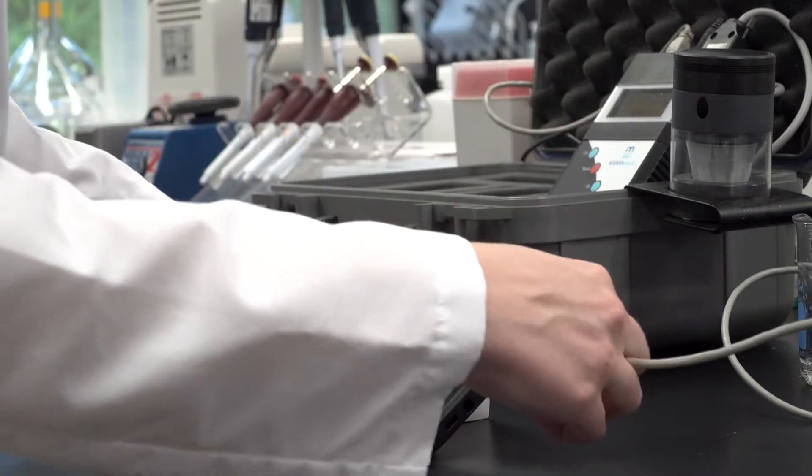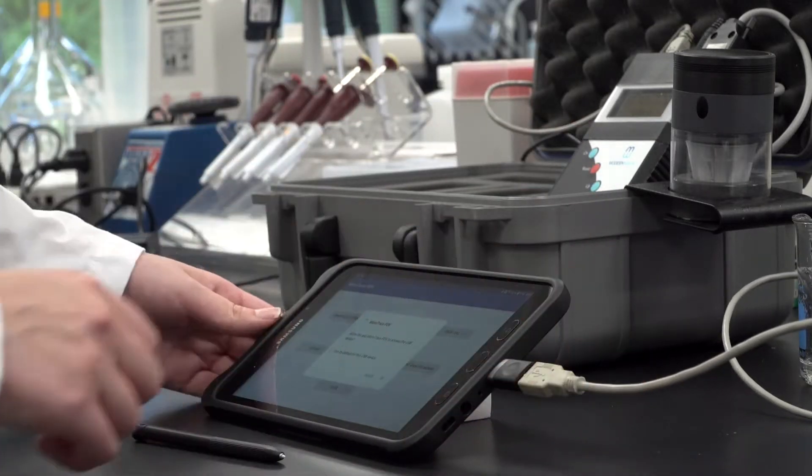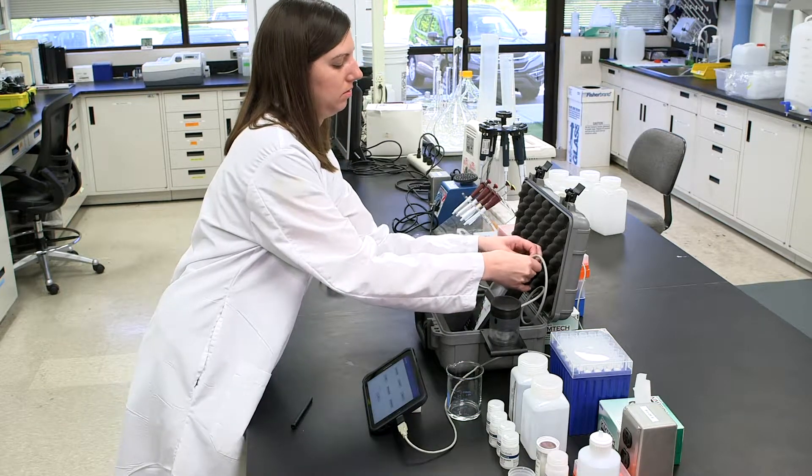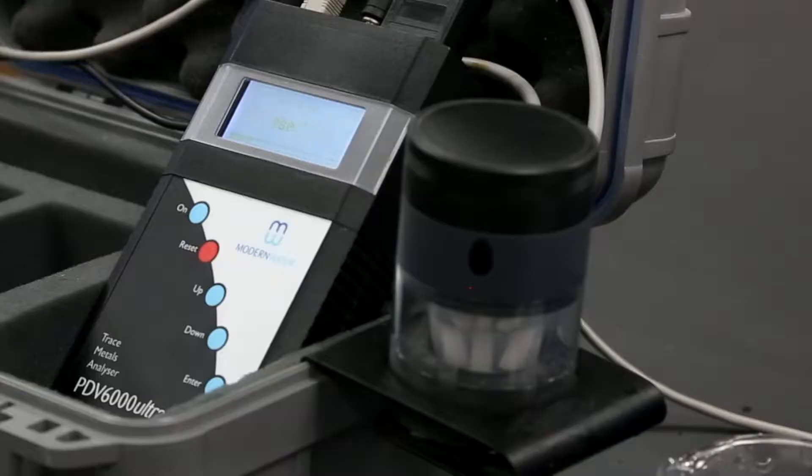Connect the cables for the analysis cell, USB cable to tablet, and power supply if required. Check that the stirrer is working by pressing the reset button for a few seconds. It should be clearly audible as a light buzzing sound.